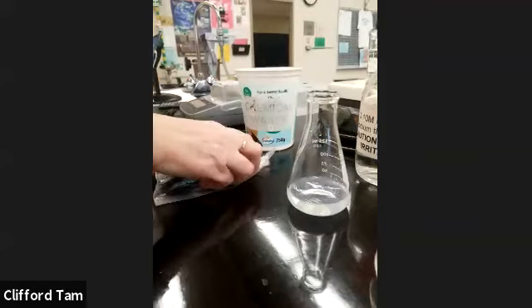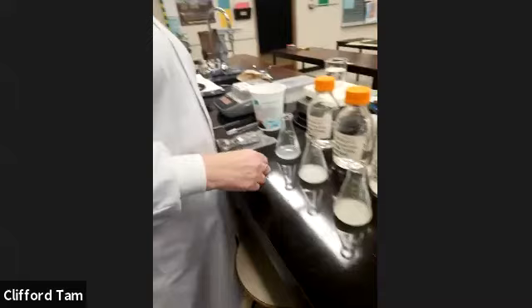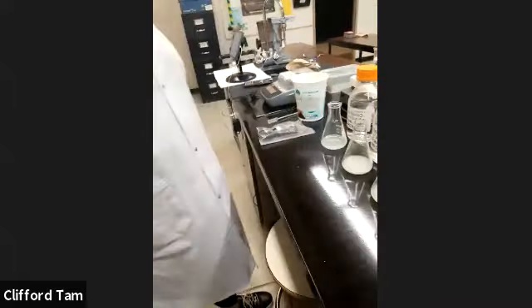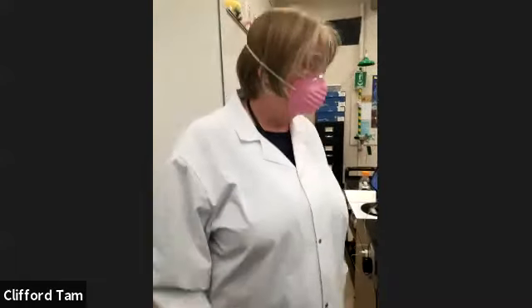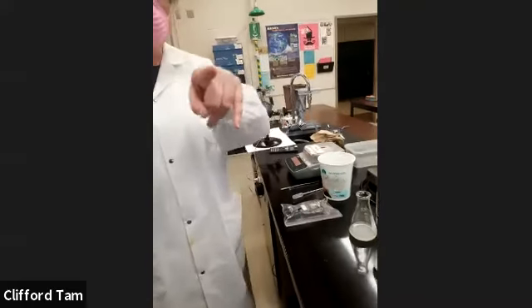There you go. Okay, and that's it. 21.06. 21.06 seconds. Yes, beautiful. Okay, so the next one after this, we've done concentration. Perfect. So could you bring up the next one?